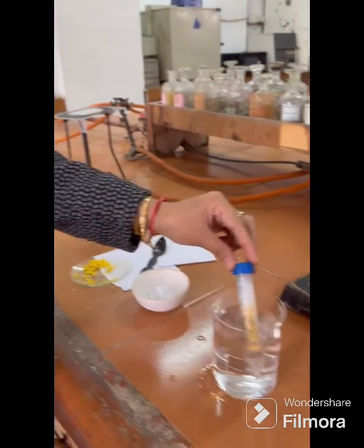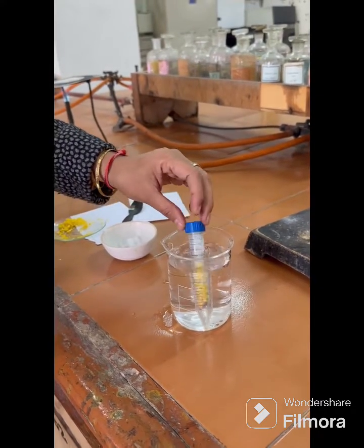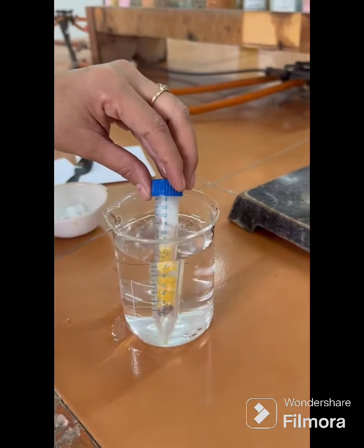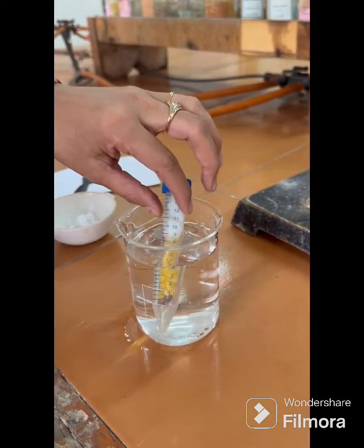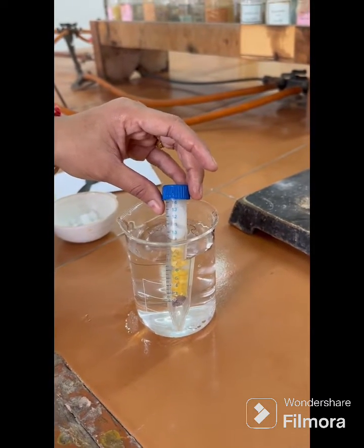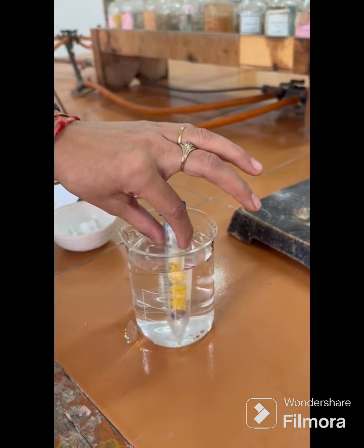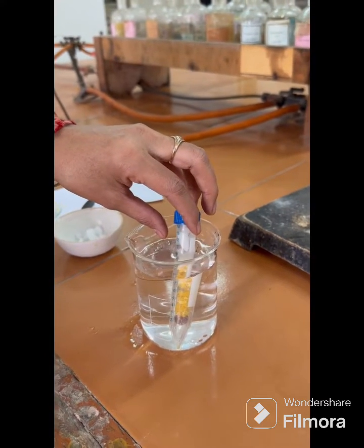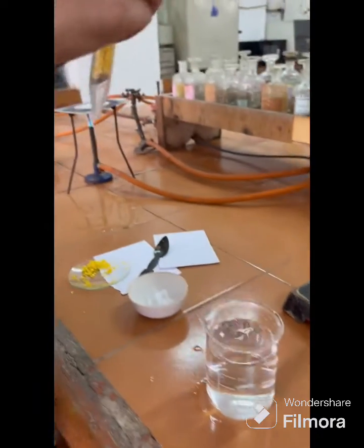Now put it in hot water. The liquid carbon dioxide will pass through the peel and will extract limonene. Once all the dry ice disappears, add more dry ice to it and repeat the procedure by filling more dry ice into the polypropylene tube and again placing it into hot water.